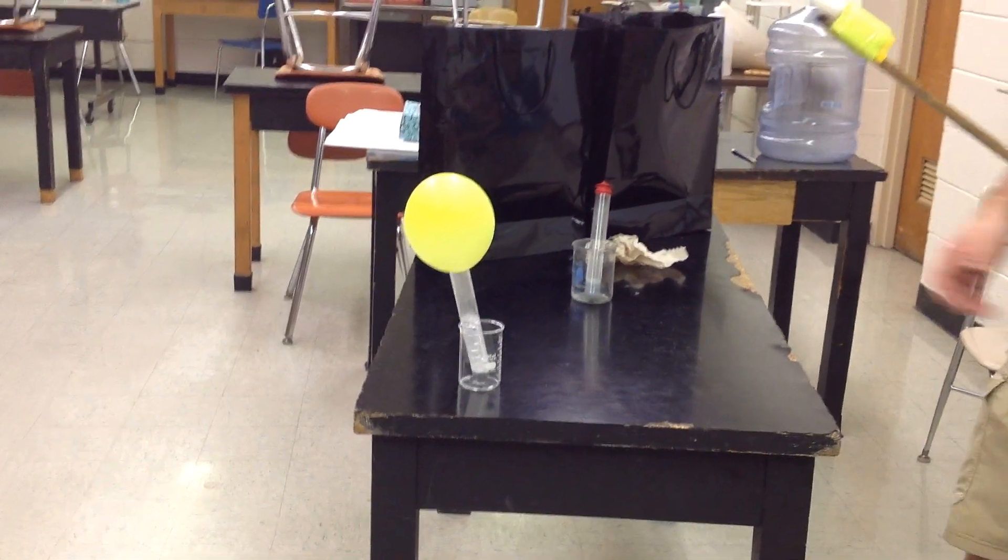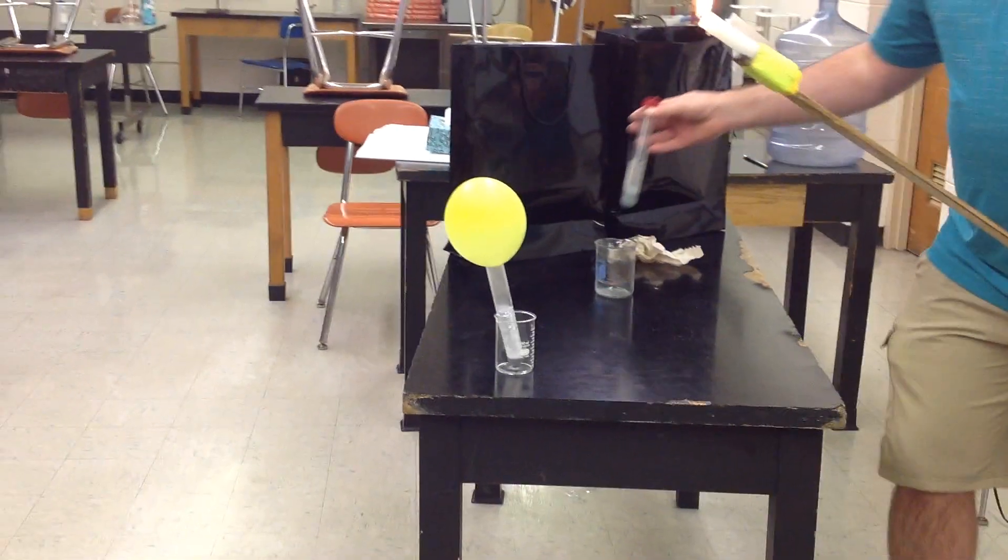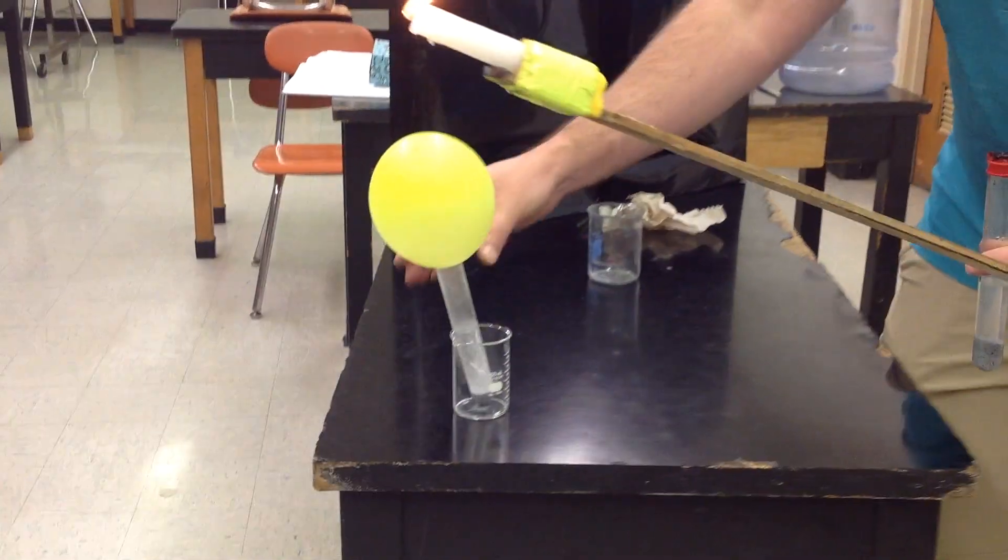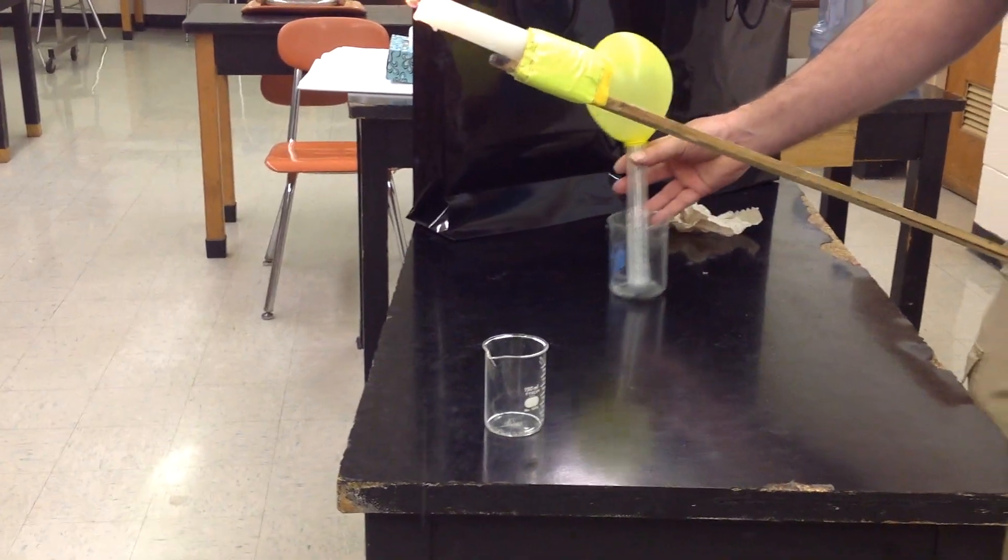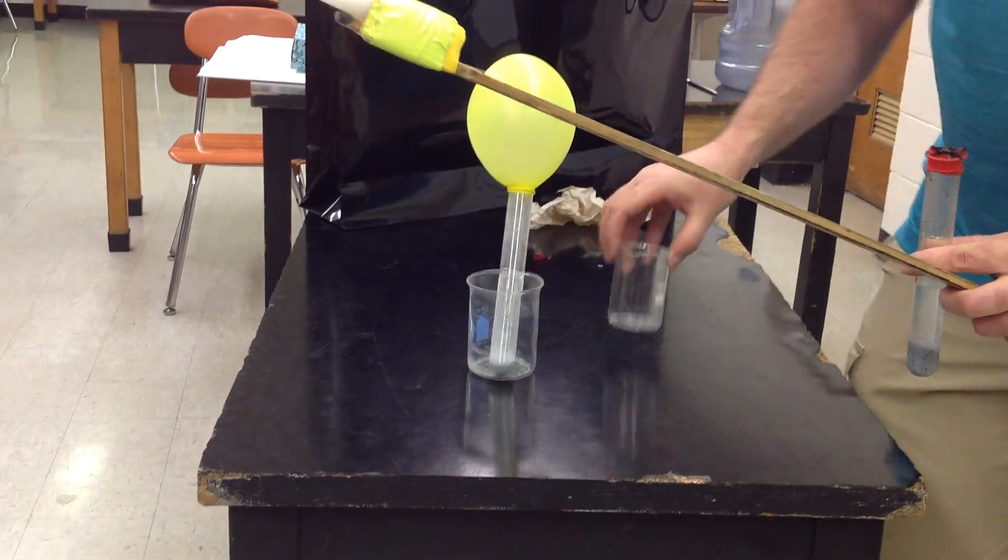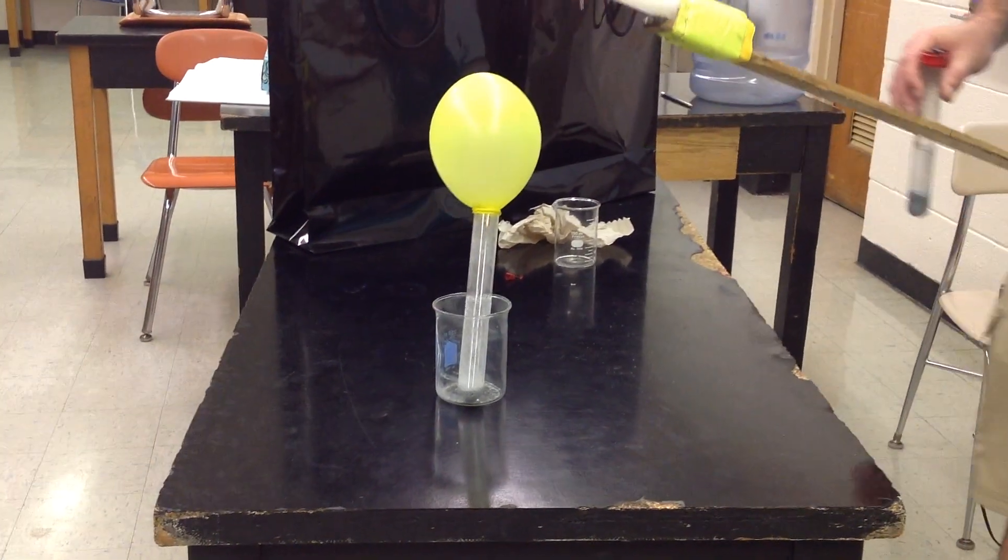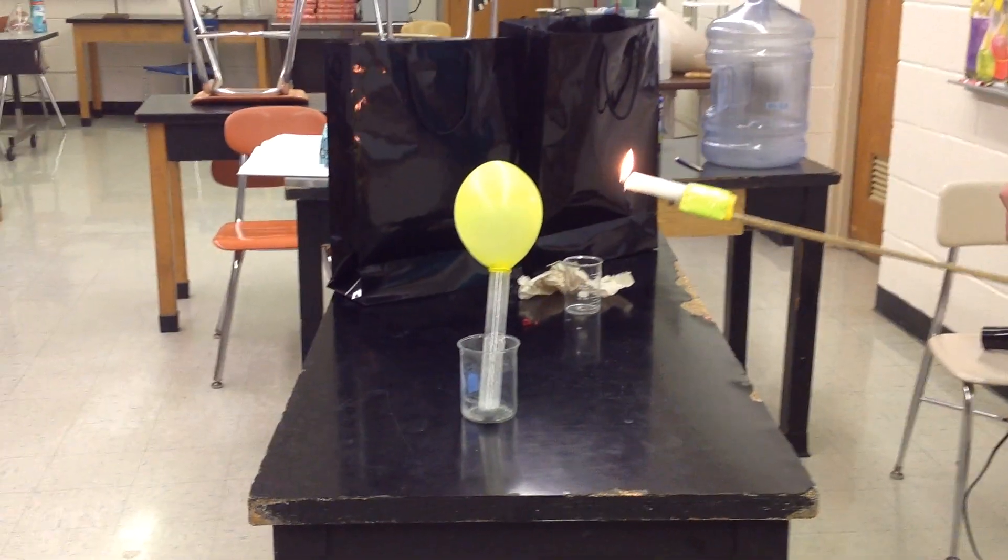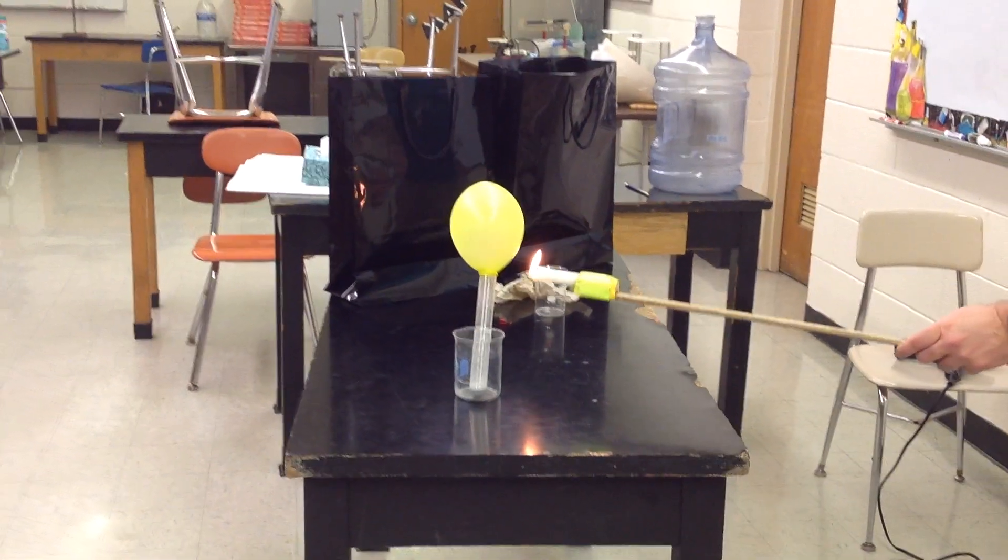Do it again. One more time. I am going to switch out and make sure we use the big beaker this time. We're going to try the big beaker and look at all those bubbles - indication of a chemical change. So here we go, we're going to try it one more time. Whoo, nice!